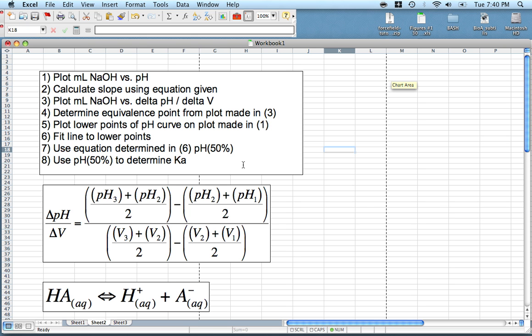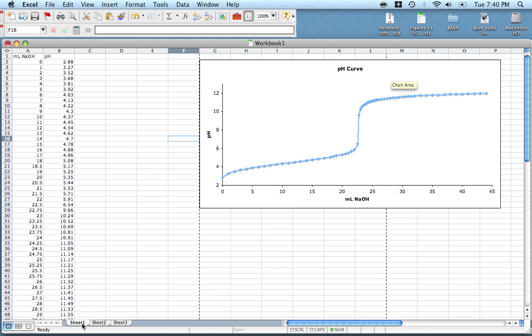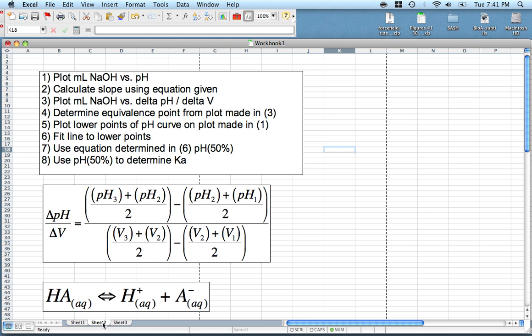So the first thing you want to do is just plot out your pH curve. Here on the y-axis we have the pH of our solution, versus on the x-axis we have milliliters of the sodium hydroxide added. So you should get something like this. This is a very good example where we don't have a lot of data points here in the center. We didn't extend too far. If you extend way far out here, it's not a big deal. Don't worry about it.